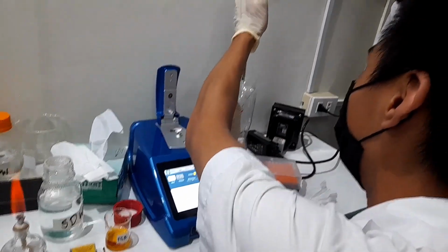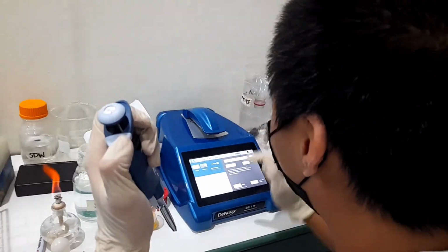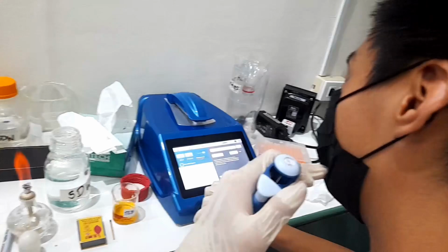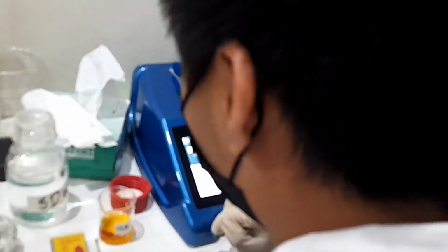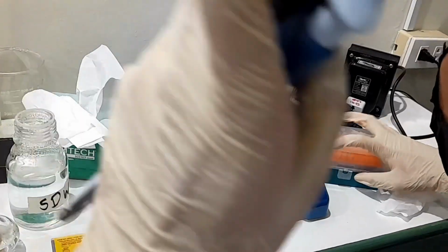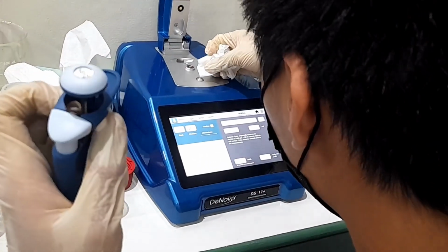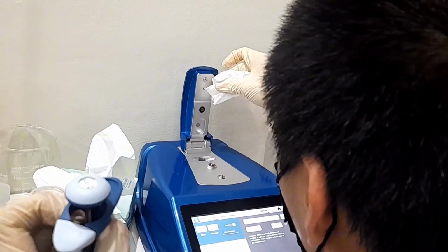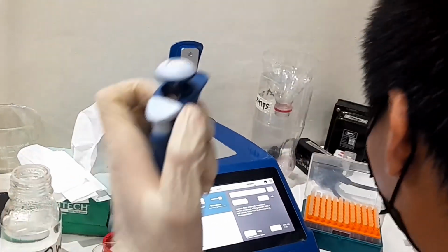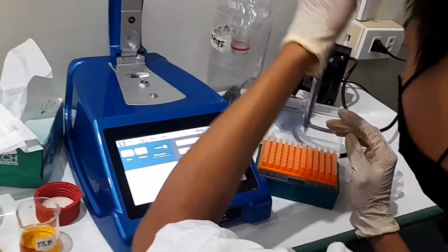You put it in the wells, and then you put the plate reader in, and it'll just read the plate. It's much easier. You're doing plate reader because it's like biofilm stuff, but for most things, like if you're doing plasmids, this one is better, because you're not doing multiple ones, so it's kind of a waste of a plate. So if you do biofilm, then yes, you use up all the wells.